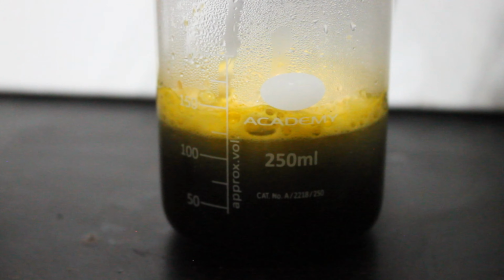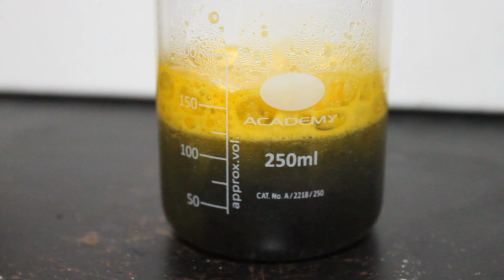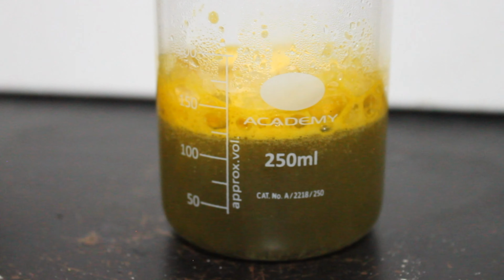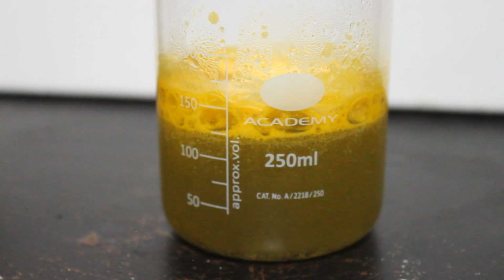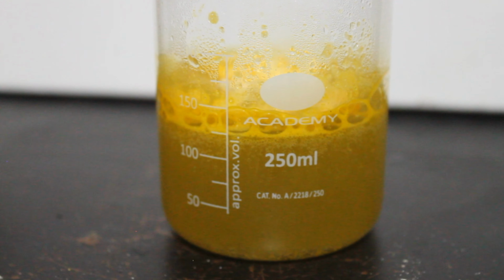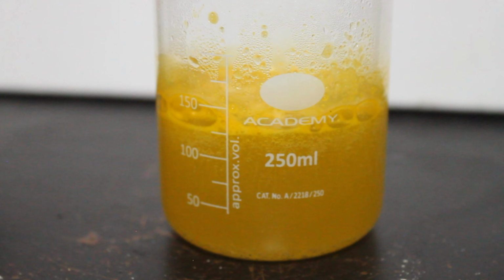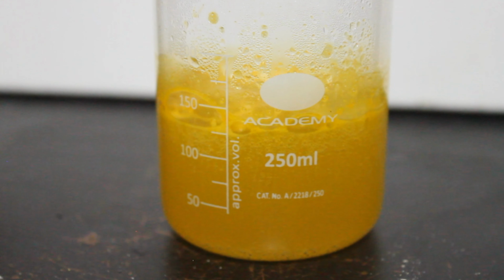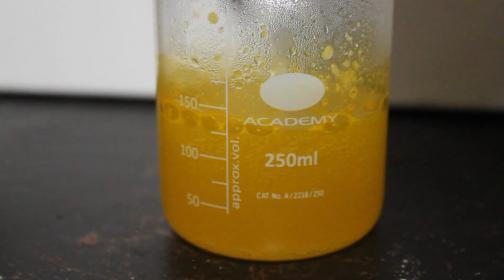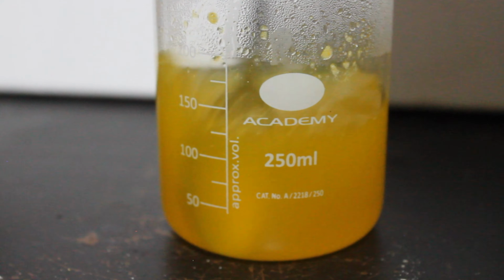If we crush up a second vitamin C tablet and pour that in, the colour begins to change once again as the vitamin C is converting iodine into colourless iodide molecules, just like what we saw earlier. And before long, all that remains is the yellow-orange colour of the vitamin C tablet.